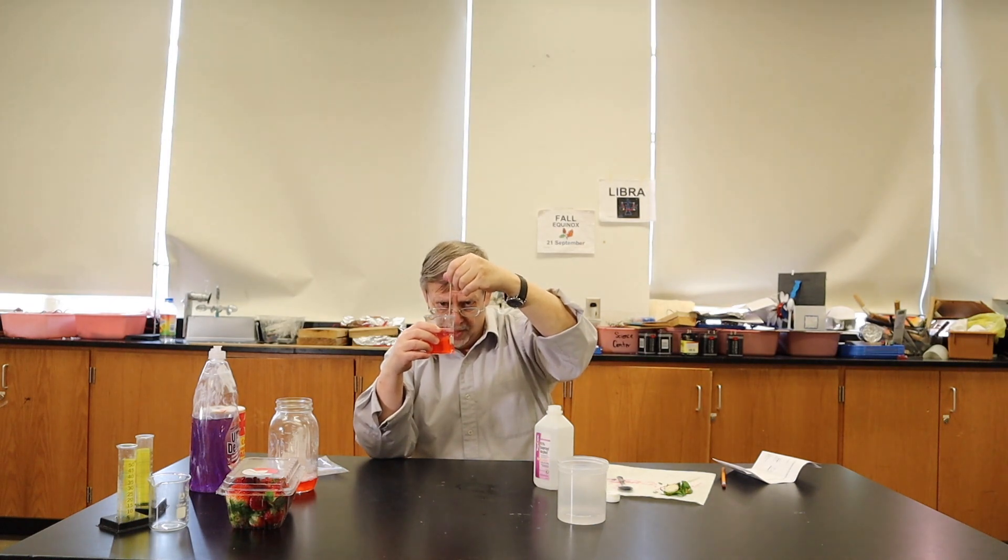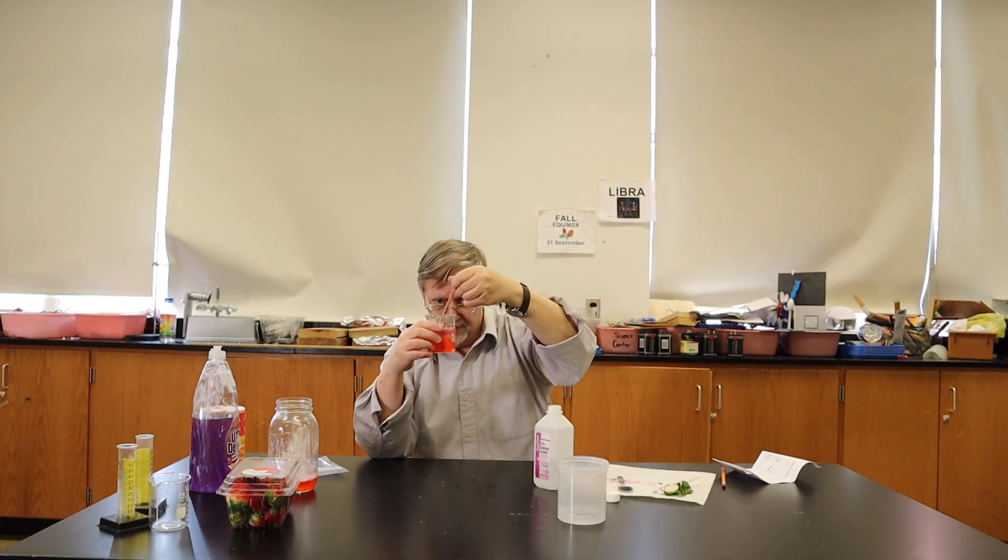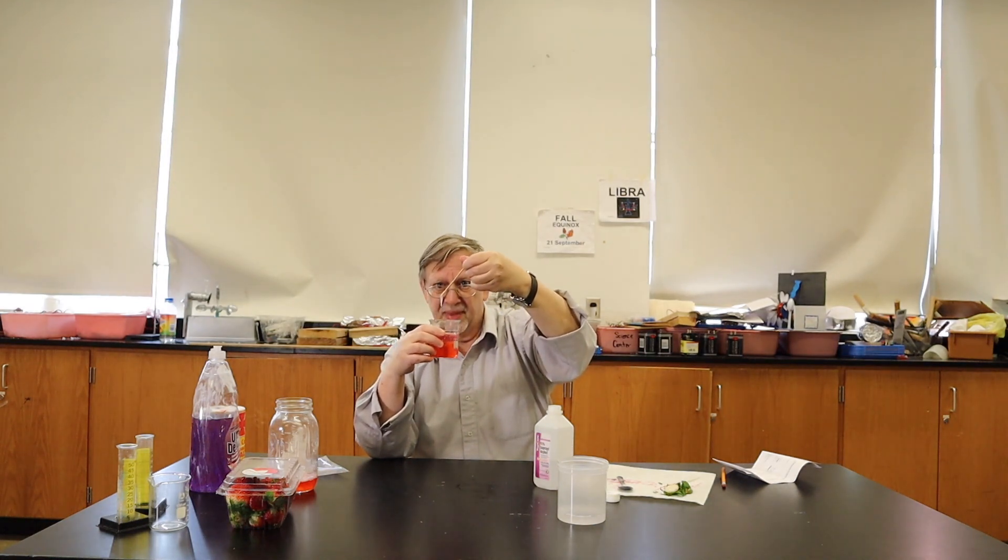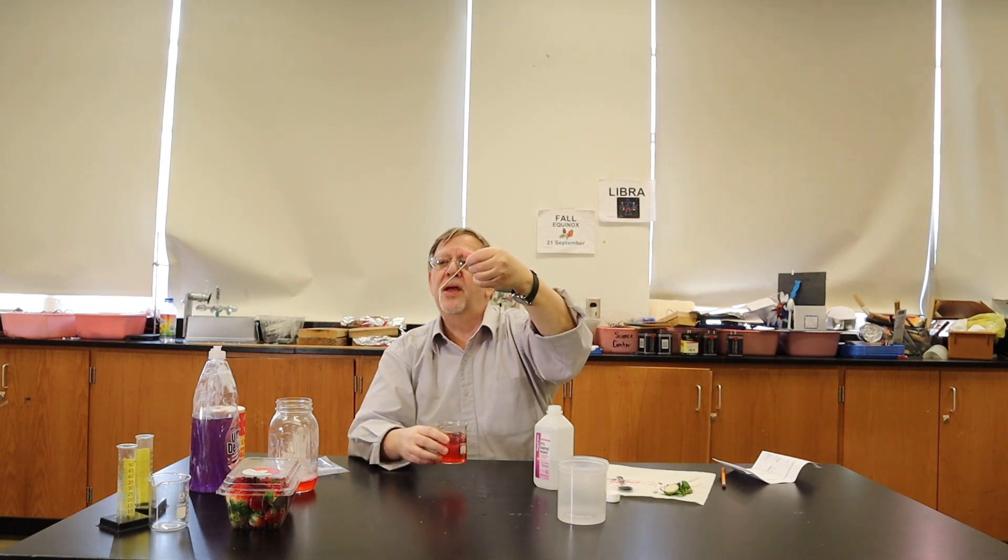Now we can pull it around some more and get some more. This is a better batch over here. And there is DNA.